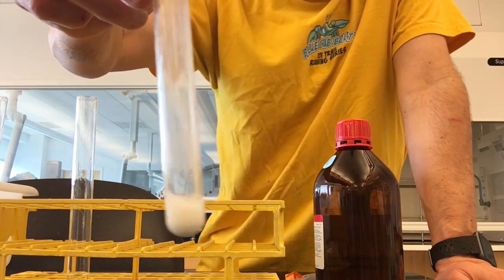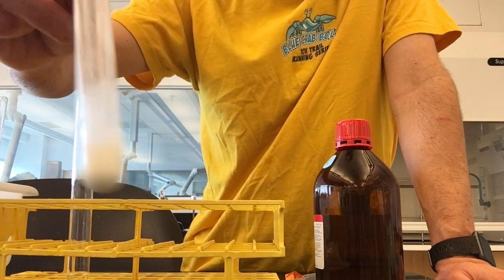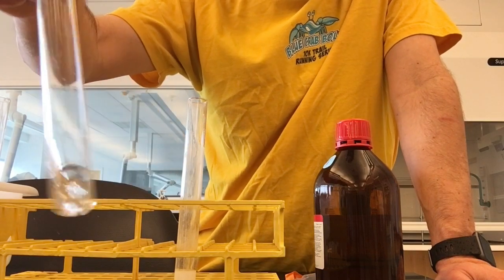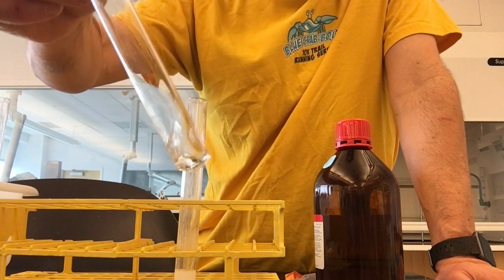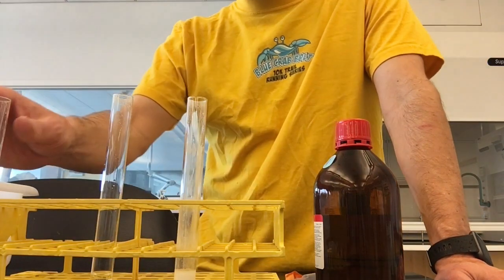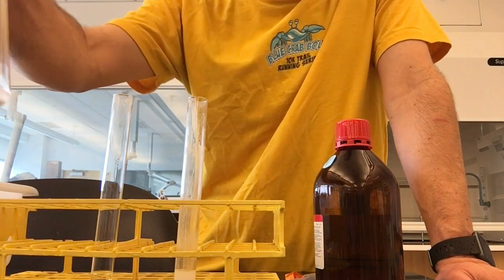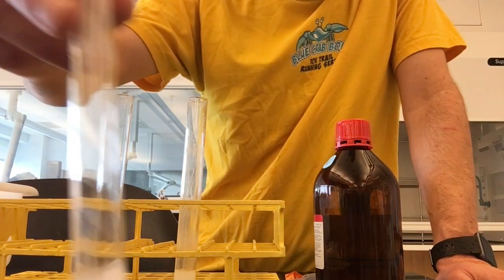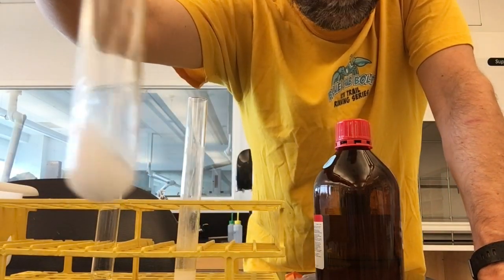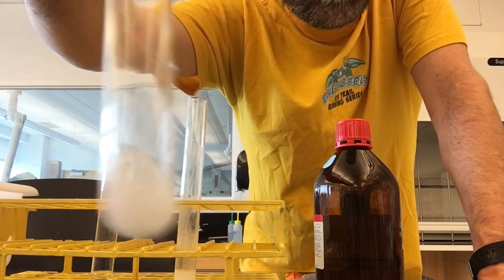You can see that the bromoethane, the primary bromide, reacted essentially immediately, whereas the 2-bromopropane, the secondary one, doesn't react immediately. I took a sample of the 2-bromopropane that I made earlier and heated it in a boiling water bath for about 30 to 45 seconds, and you can see when I do that, there is a solid that forms. So the 2-bromopropane does react after heating, and the bromoethane reacts immediately.